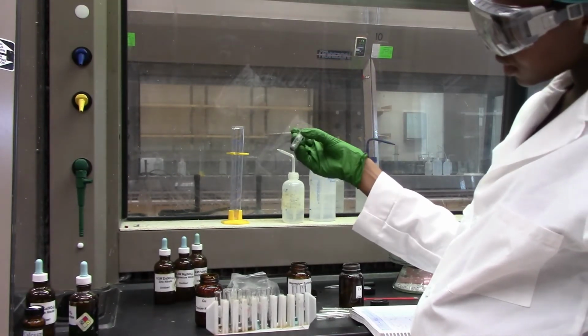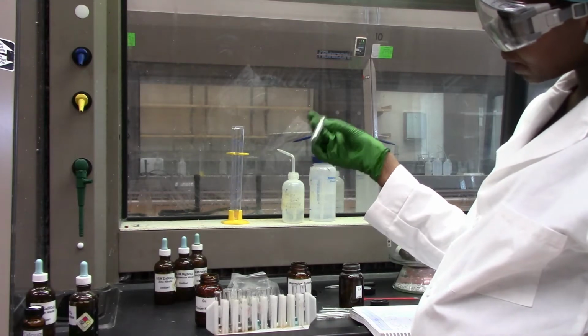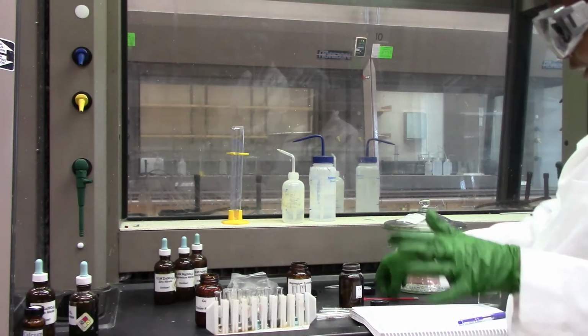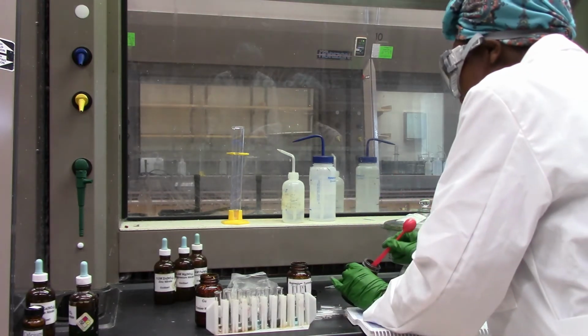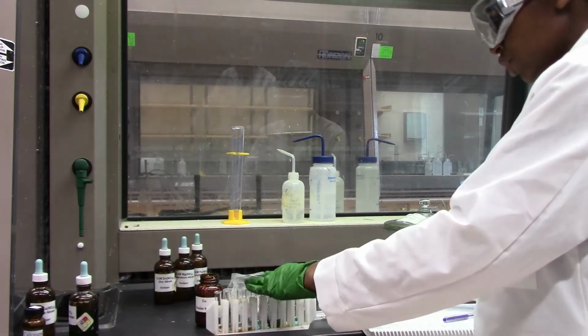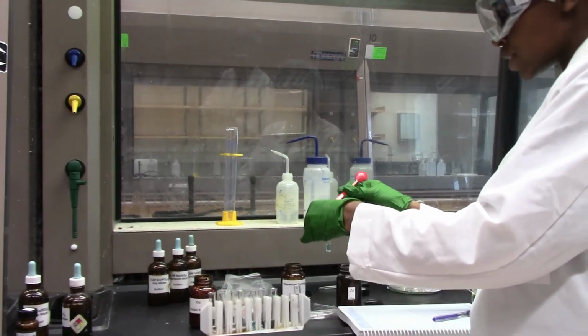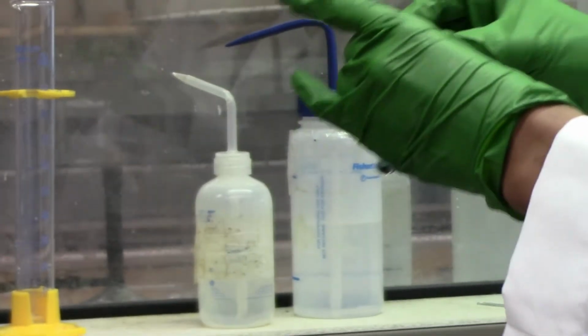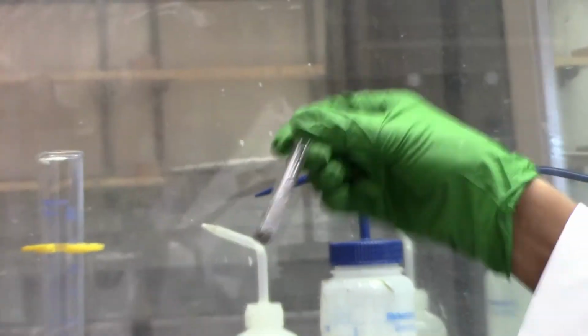We'll let it sit for about 2 minutes and we'll go back and see the color of the solution that we have. In the meantime, we'll go ahead and add some zinc to the copper solution and do the same thing. Just observe what's happening in solution, what's happening to the zinc color, and what's happening to the copper 2 color.